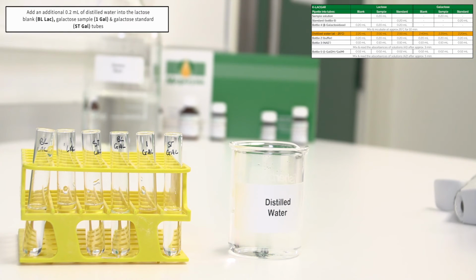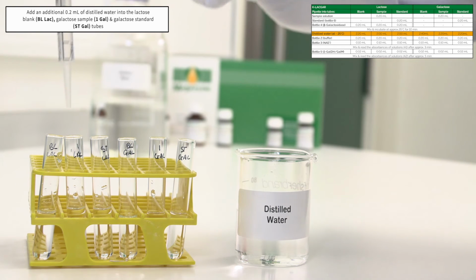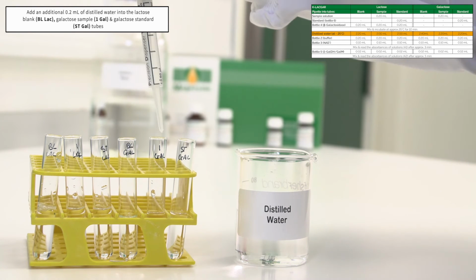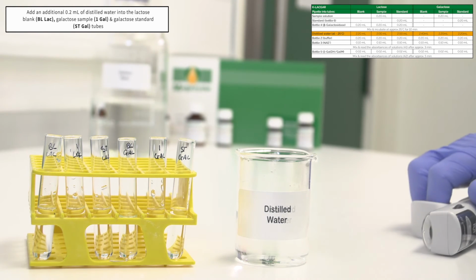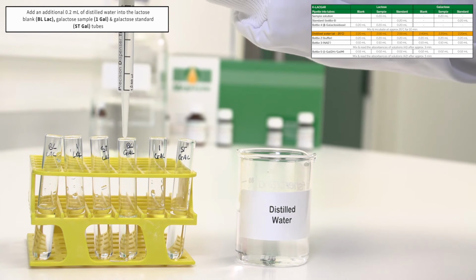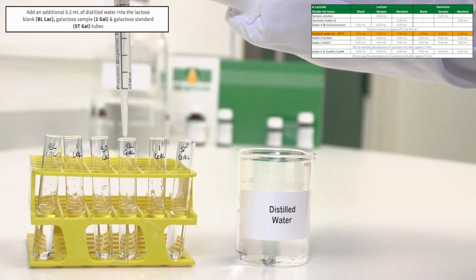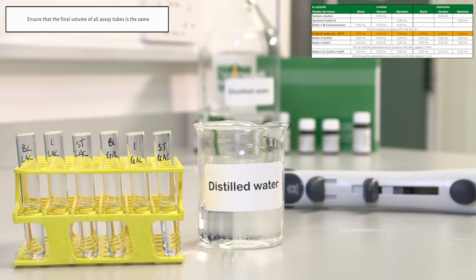Pipette an additional 0.2 millilitres of distilled water into the lactose blank assay tube, BL-LAC, the galactose sample tube, 1 GAL, and also into the galactose standard tube in the galactose reaction, ST-GAL. Pipette an additional 0.4 millilitres of distilled water into the galactose blank tube, BL-GAL, thus ensuring that the final volume of all assay tubes is the same.